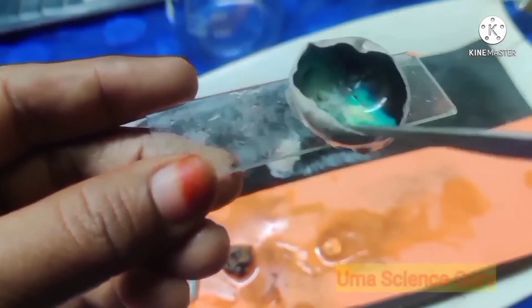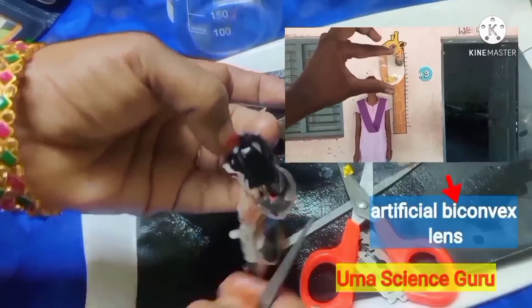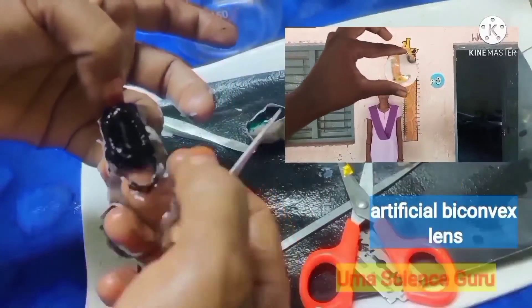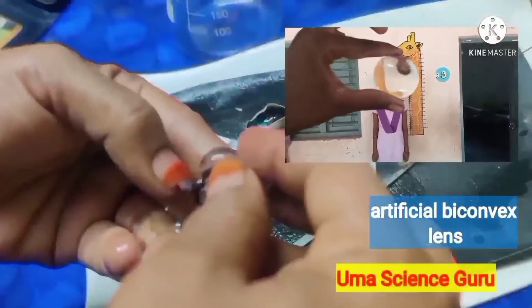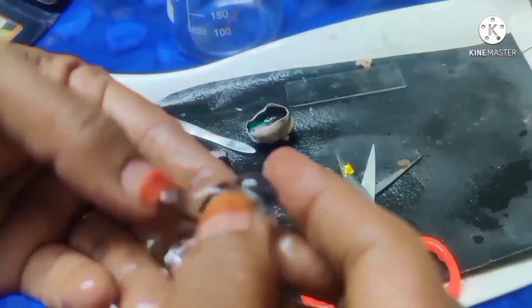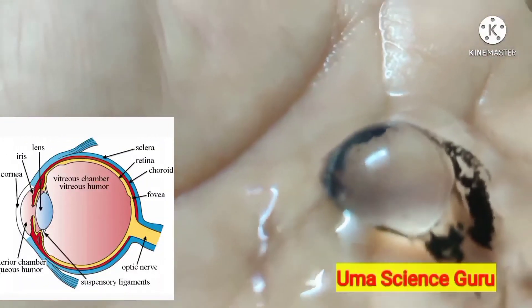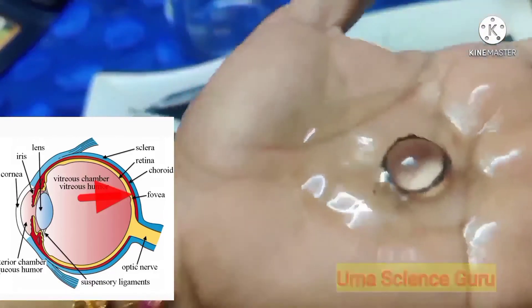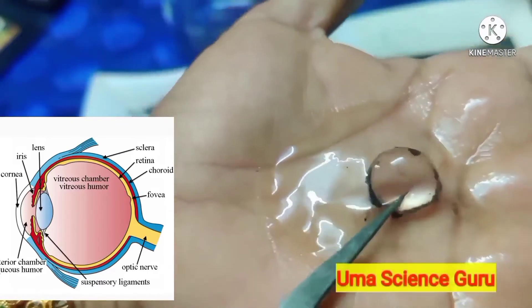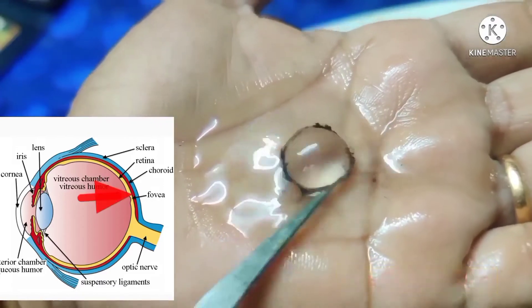Students, now observe the amazing part of our eyes — the biconvex lens. Observe the artificial biconvex lens in this video: the image in the artificial biconvex lens is upside down and smaller than the object. Now observe the natural transparent crystalline biconvex lens in the eye. It is present immediately behind the pupil and is attached to the ciliary muscles and suspensory ligaments.